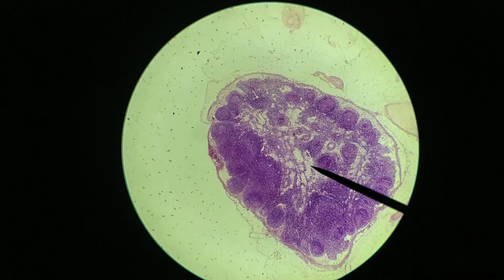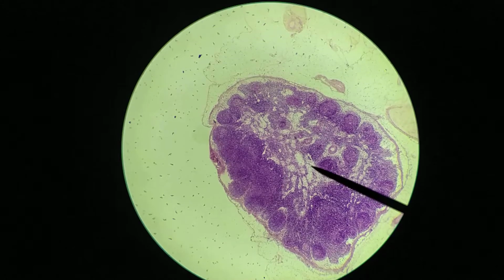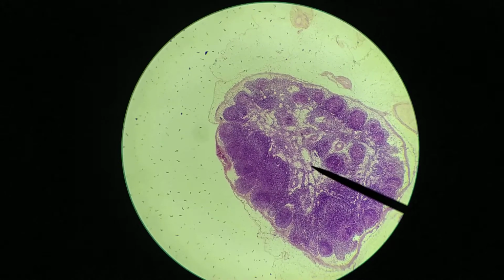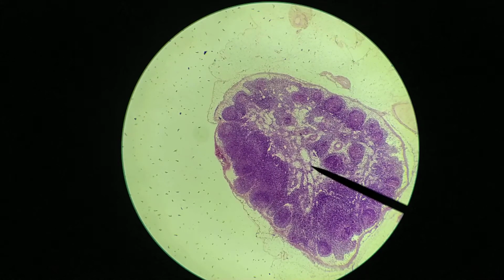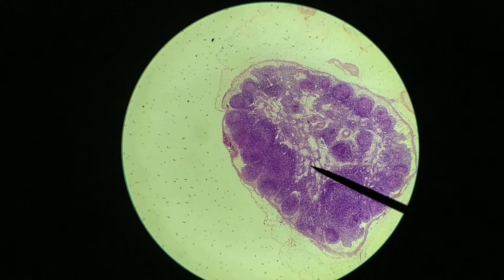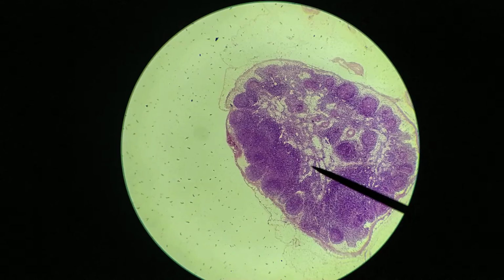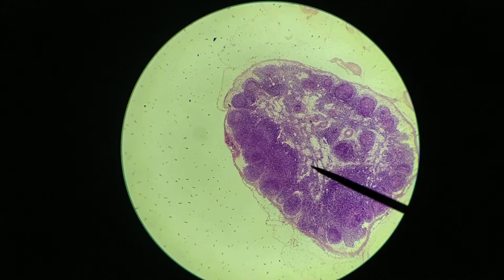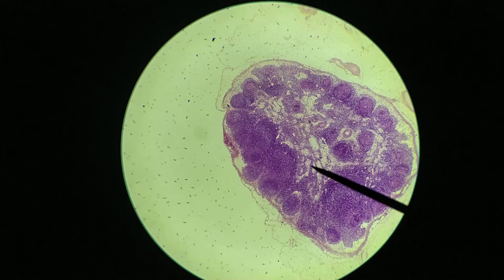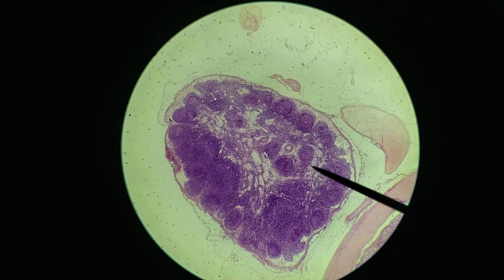And so in the medulla, what you're seeing is these lighter regions, like this, for example, here, or like this here. This is called a medullary sinus. And the darker regions around the outside of those sinuses, like this part right there, this part right there, this is called the medullary cord. So the lymph will flow through the sinuses. The cords are like the walls around the outside of these tunnels. Okay, so this is the general organization of a lymph node.